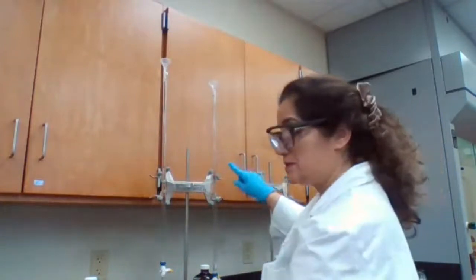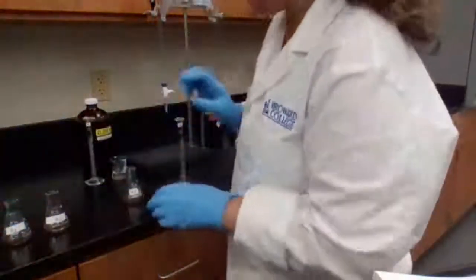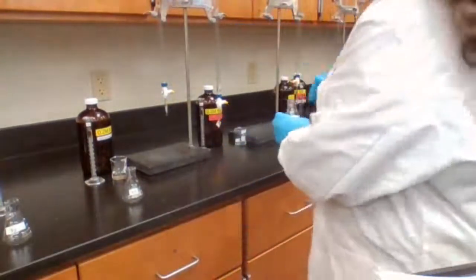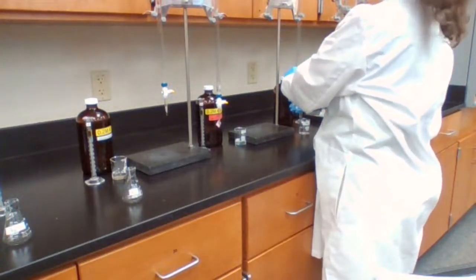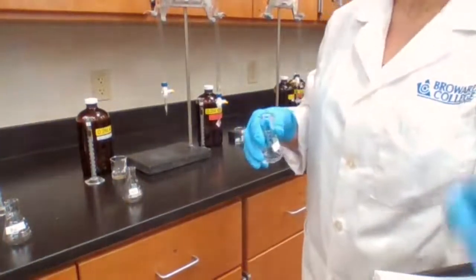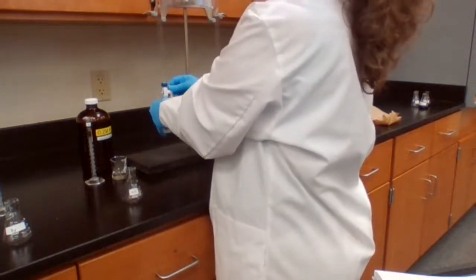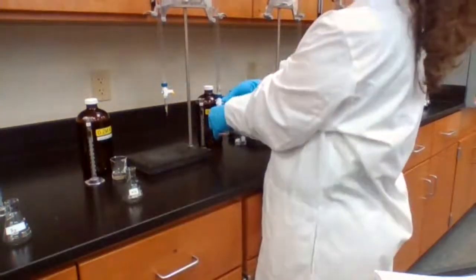This is kind of slow. So while it's taking time, see it's coming drop by drop. It's kind of slow. A3 is ready. A4, same thing. 1 milliliter of starch. 2 milliliters of S2O3, going from 16 to 18. 4 milliliters of KI and 4 milliliters of KNO3. 27 to 31. 24 to 28.